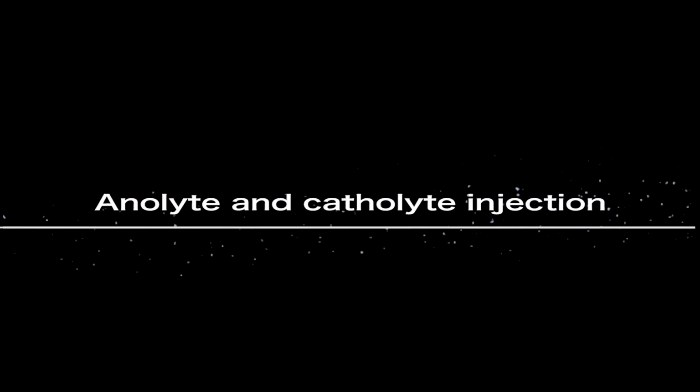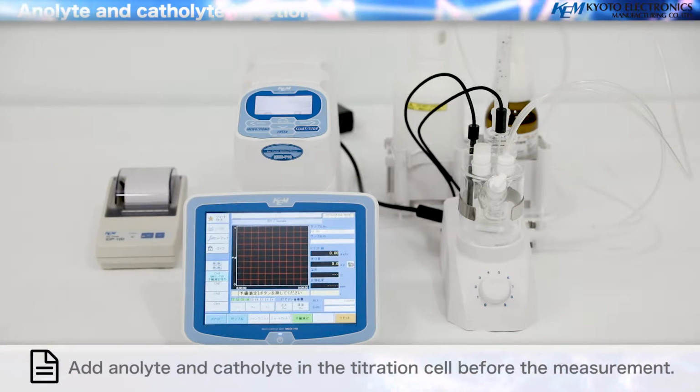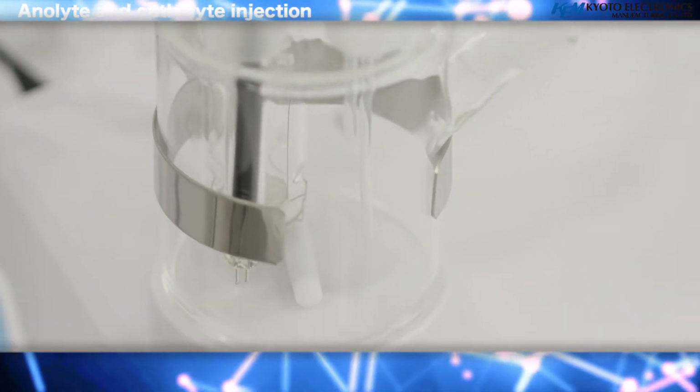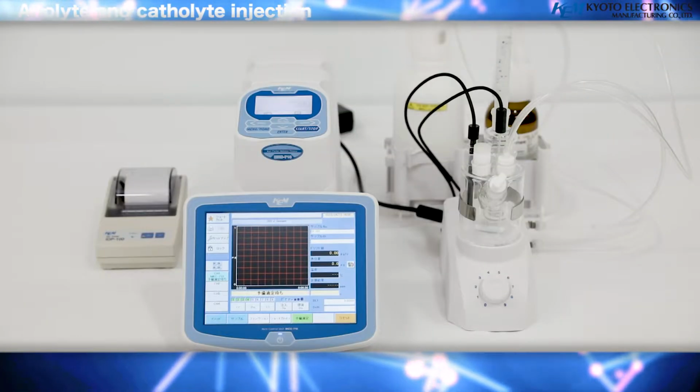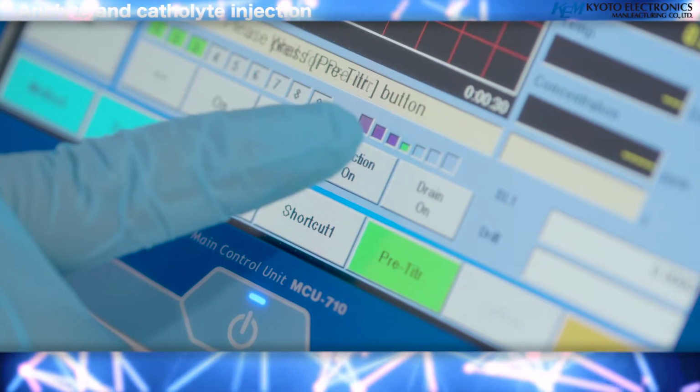Anolyte and catholyte injection. Add anolyte and catholyte in the titration cell before the measurement. First, add the anolyte into the titration cell. Press the injection on button and inject the anolyte into the titration cell.